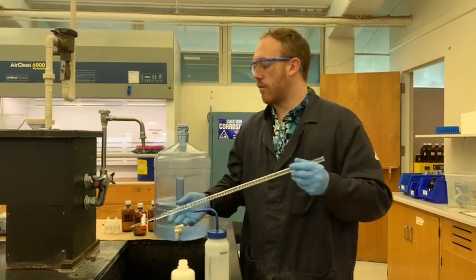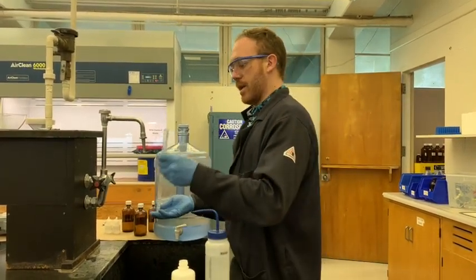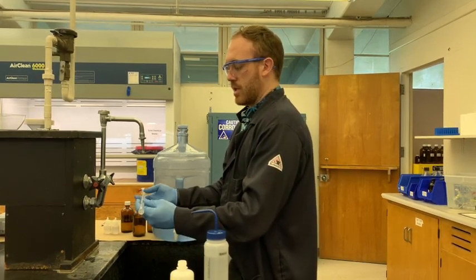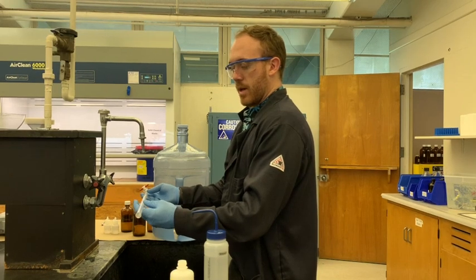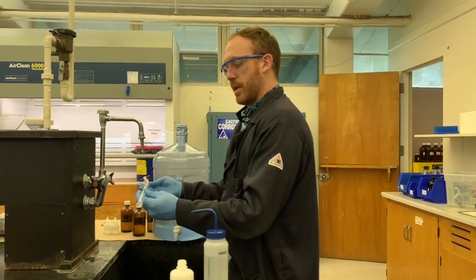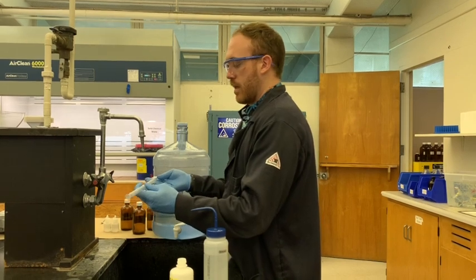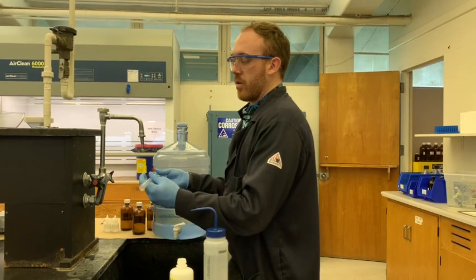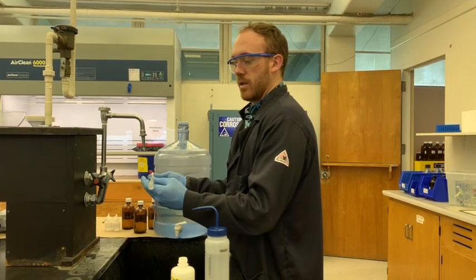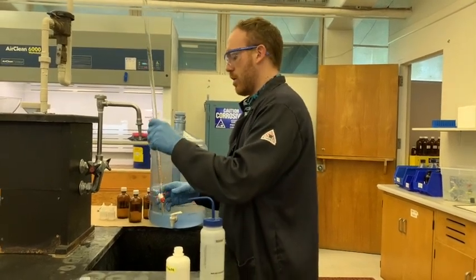And I'm going to roll it around the inside of my burette, being careful not to spill any of this, which is still NaOH, just so I coat the surface with the solution. The reason that we're doing this is primarily to coat the surface with what's actually going to be inside of the burette so that it doesn't get diluted by any of the water that might also be on the surface. That way all of that water, which would be diluting the solution, is diluted now and removed by this solution, which we're going to wash out.